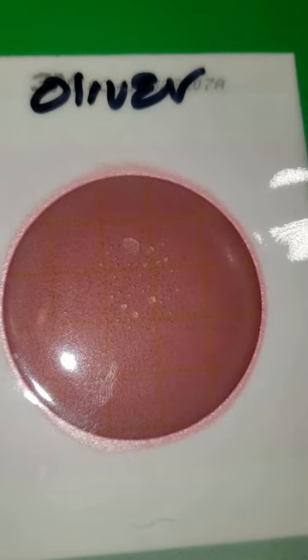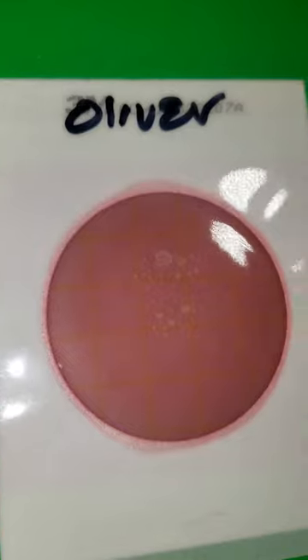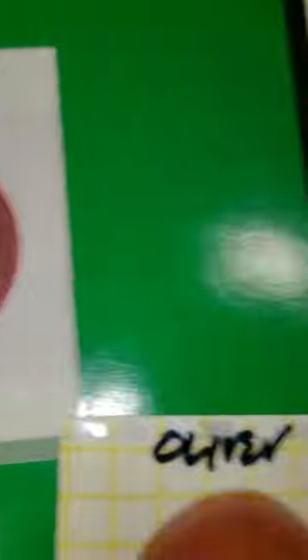The last plate we do is called a coliform count. Coliform bacteria are normally present in the GI tract, but they need to be at normal levels — everything is supposed to be in balance. What we're looking for is normally red, and we'll see pinpoint black dots develop as colonies. Scanning Oliver's plate, I don't even see any growth at all. That's not a bad thing — it's just saying that at this dilution, we're not able to get anything to grow. Happy, healthy horse.